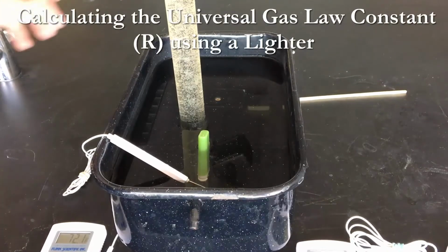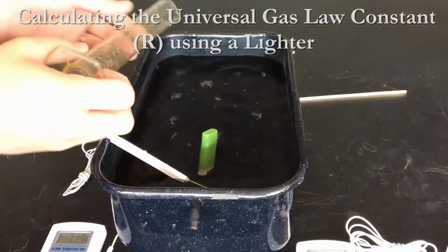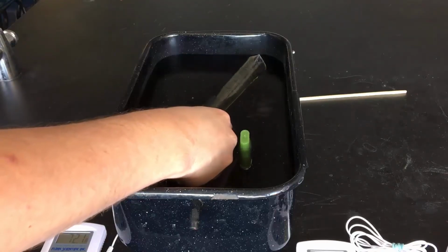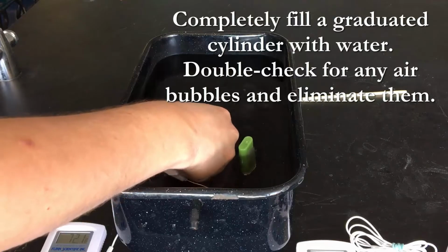Let's calculate the universal gas law constant using a lighter. We're going to collect butane gas by water displacement. So we're going to go ahead and take a graduated cylinder and completely fill it full of water.